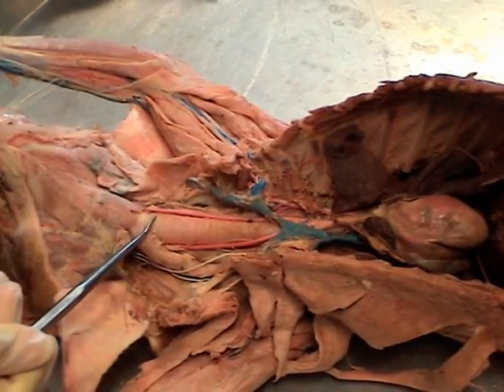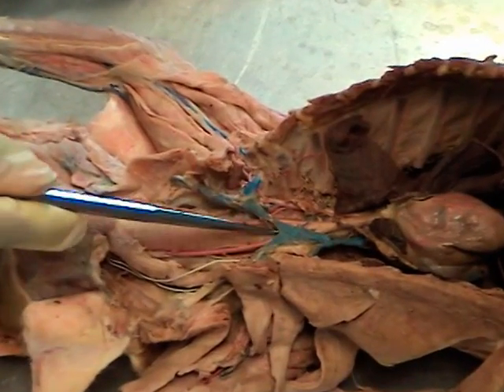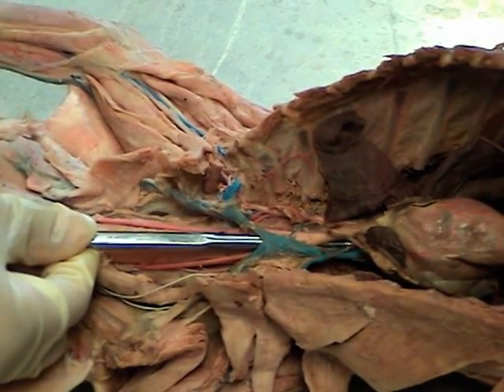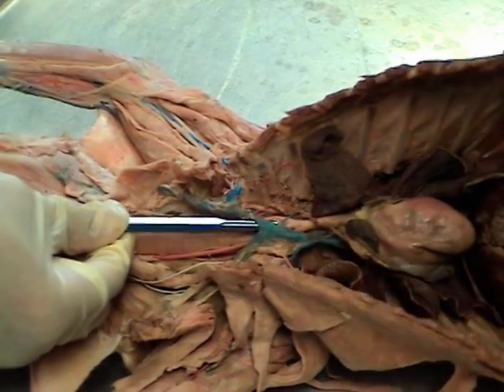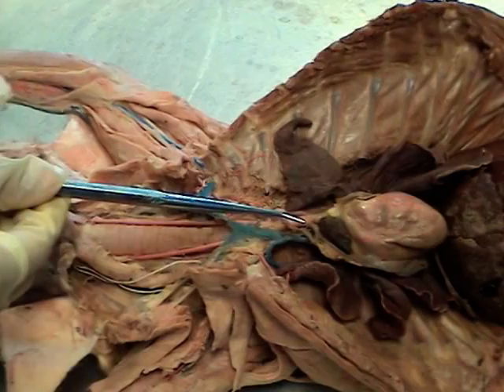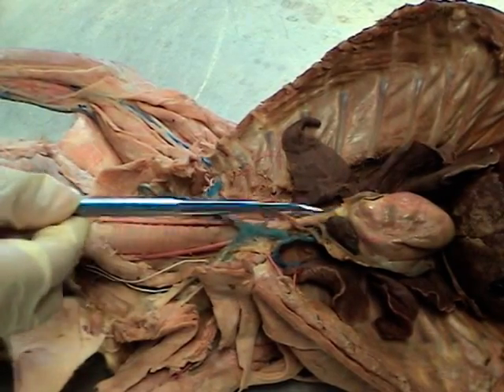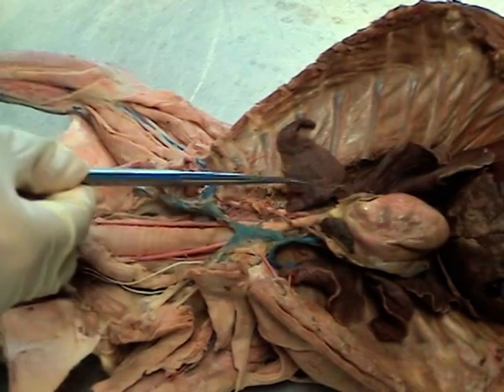As the trachea moves down the neck, we enter the thoracic cavity. Behind the heart, if you follow the probe lying on the trachea, it goes behind the heart and you will see it's going to split so that we will have two bronchi — one to the right lung and one to the left lung. We are not going to remove the heart to show you that, so just know that there is a bifurcation behind the heart here.